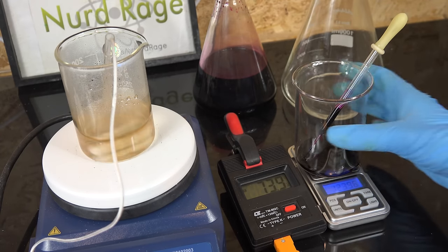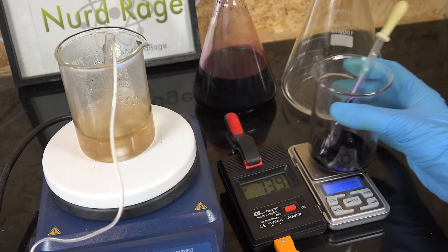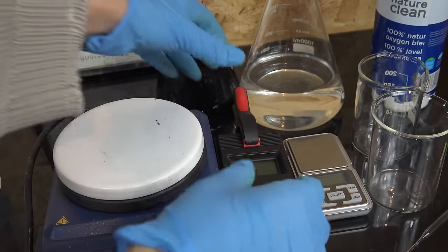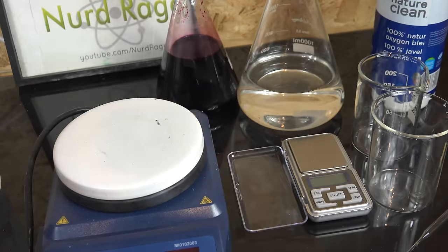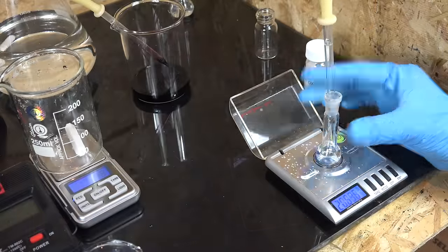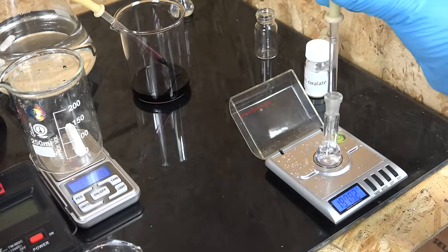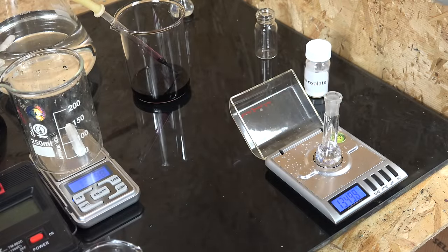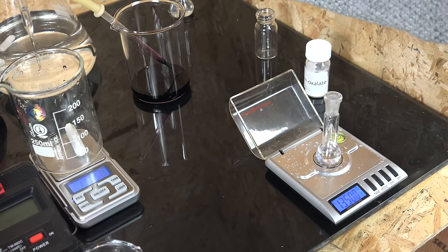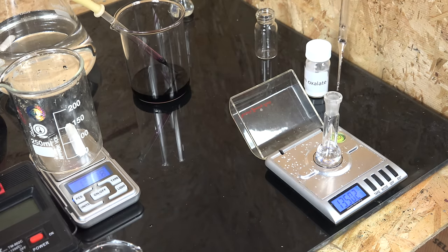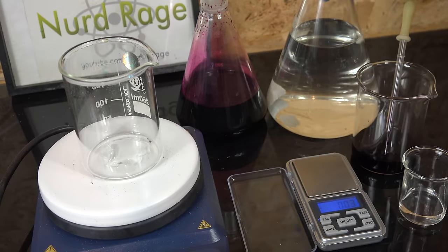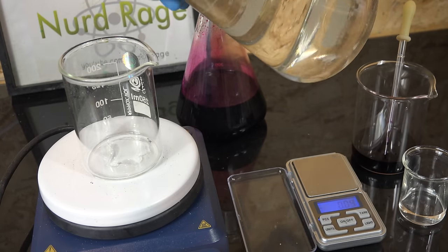Now hydrogen peroxide is very reactive, unlike sodium oxalate, so we can forego heating and set the thermometer aside. To titrate the hydrogen peroxide we weigh out one gram using the milligram scale. Once again we try to aim for one gram but record the exact amount we actually add and use that for the calculations. We then add 50mL of our supporting titration mixture of sodium bisulfate.